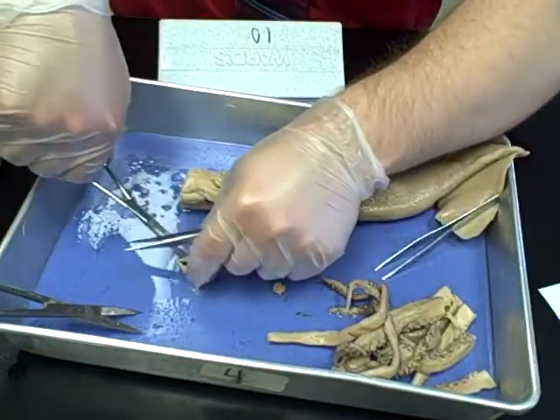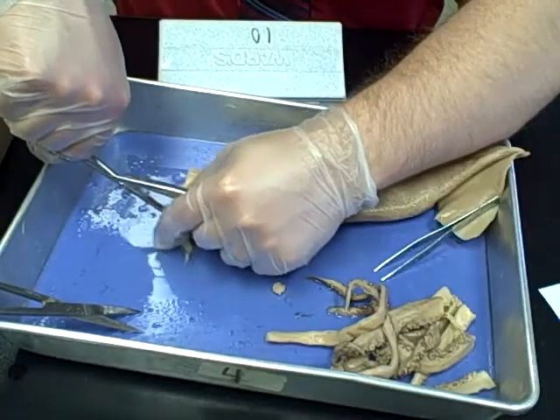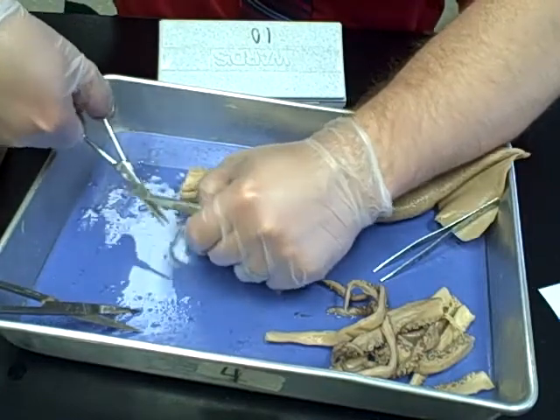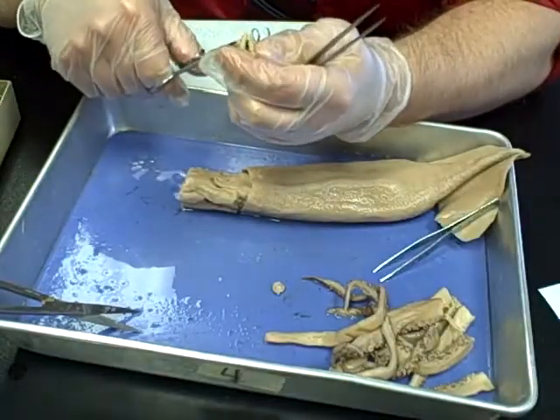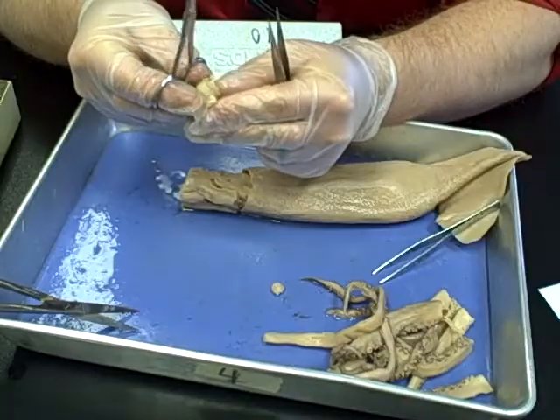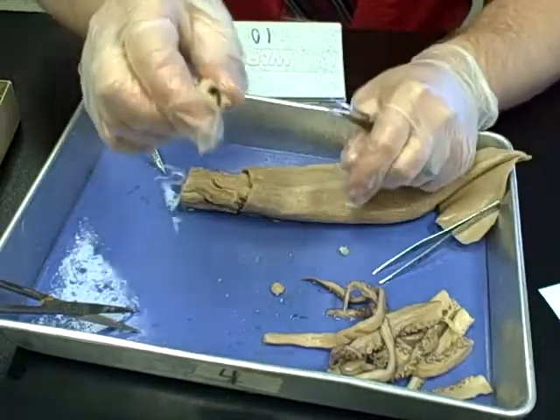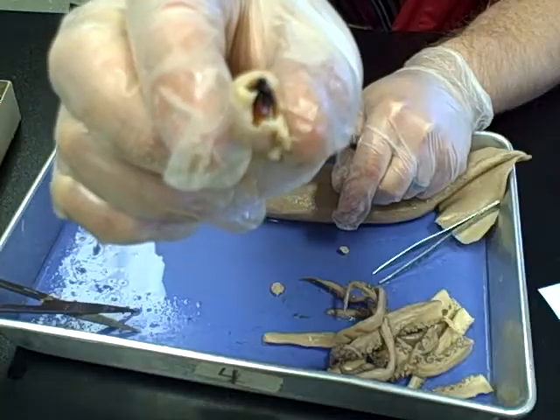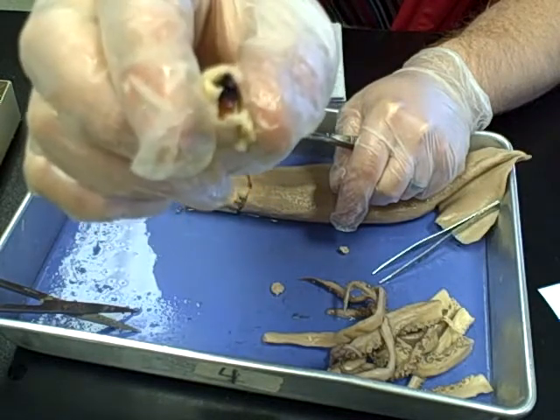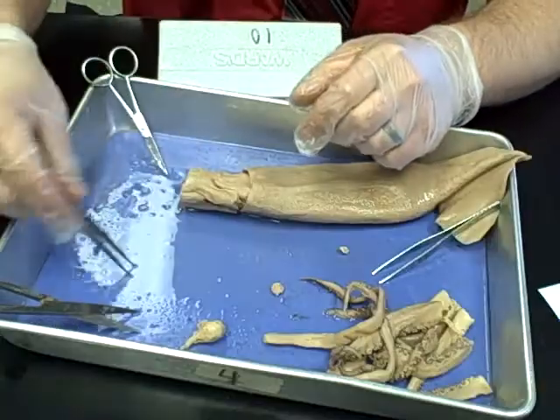Don't cut through the beak itself, which is very dark and hard on the underside. As you start removing the tissue, you'll be able to see the beak underneath — it almost looks like a bird's beak from the front, and that's what you're trying to expose. You'll have a paper to put all these pieces on, and once you remove the beak, it gets added to its assigned spot on that paper.